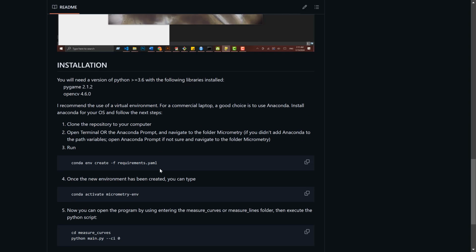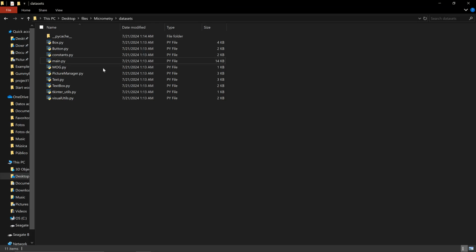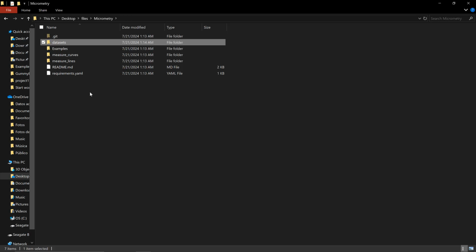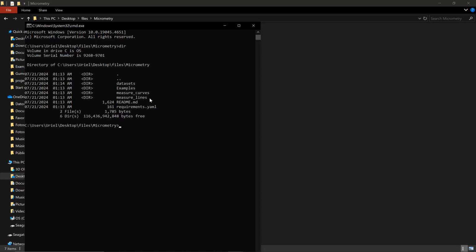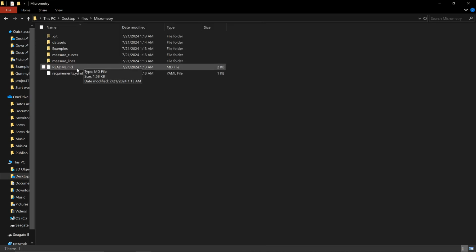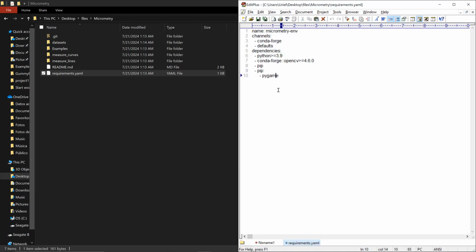And here in the GitHub page, you have a series of instructions on how to create it. I'm simply going to copy this. I'm going to go to the main Micrometry folder, and in here, I'm going to open the terminal. The reason why I do this is because I need to use a special file that is called requirements. If I open the directory, you will see it highlighted right here. Requirements, let me show it to you, is a container that has instructions on what elements we need to install.